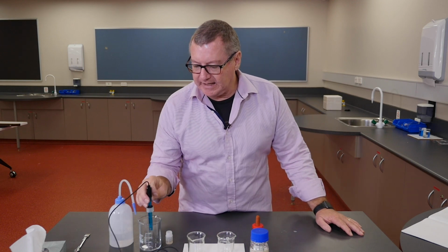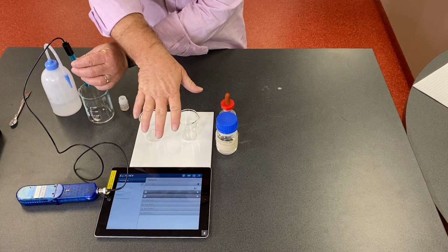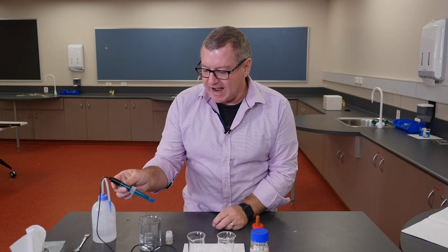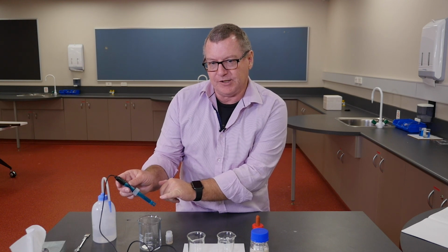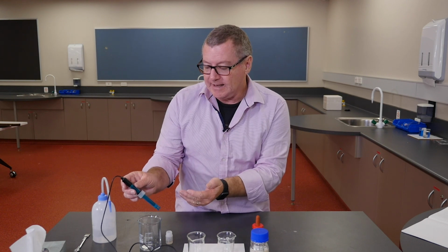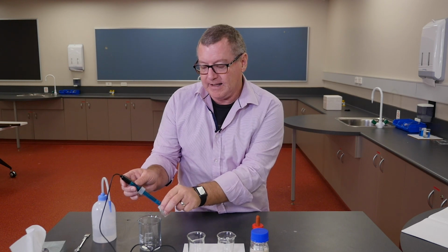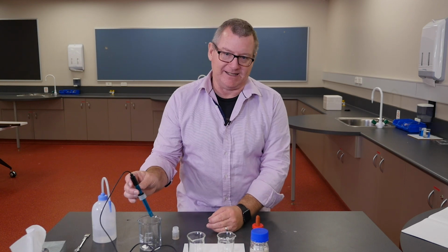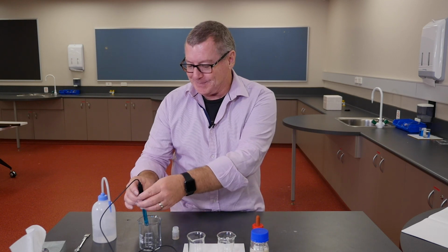So I've got a pH meter here. It's a Pasco one. It's connected to the Pasco data logger, which is connected by Bluetooth to our iPad. And pH electrodes are quite delicate. It's got a little glass bulb in the end here that is so thin that it's possible for ions to go through it. It's very delicate. It lives in a little bottle of 4 molar potassium chloride, and you have to keep it damp. If you let it dry out, you've basically wrecked your very expensive pH electrode. So if you have them in your school, that's some tips about how to treat them.